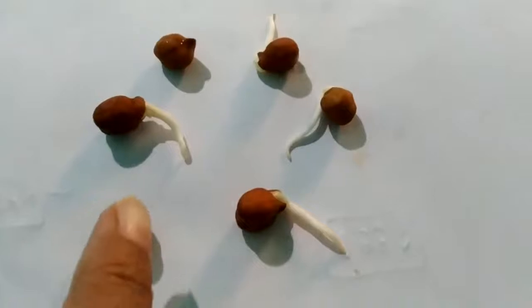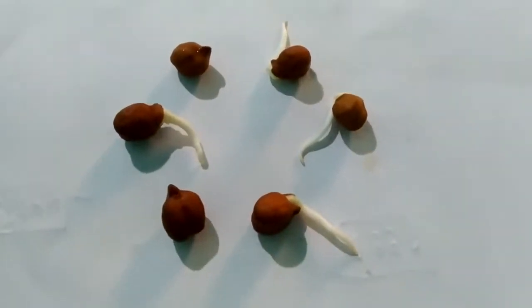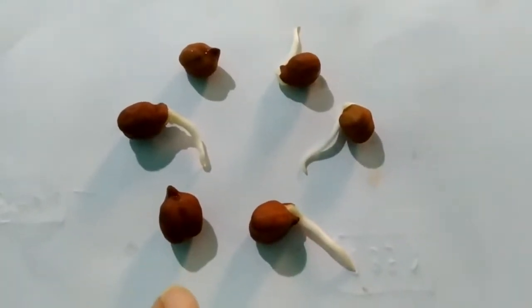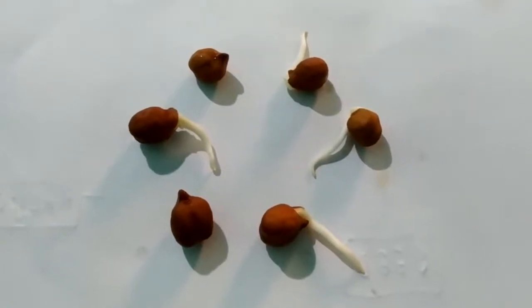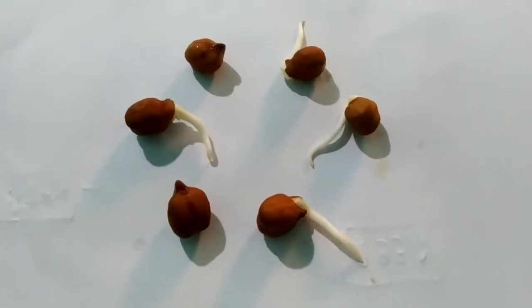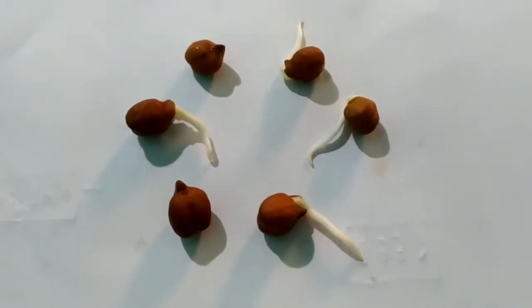This brown-colored outer covering which you all can see, this is the seed coat. The seed coat mainly consists of two parts: one is the testa and another is the tegmen. The testa and tegmen mainly protect the seed from mechanical injury and prevent the internal tissue from microbial invasion or growth inside.